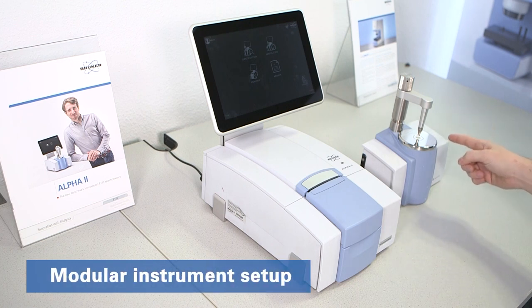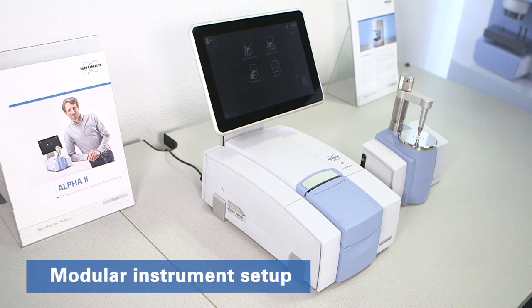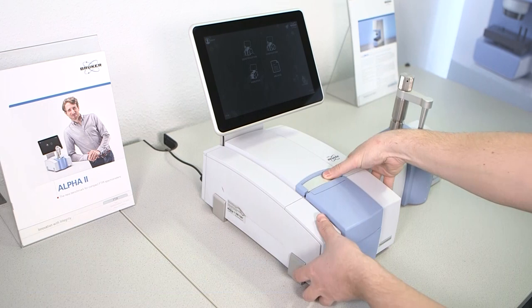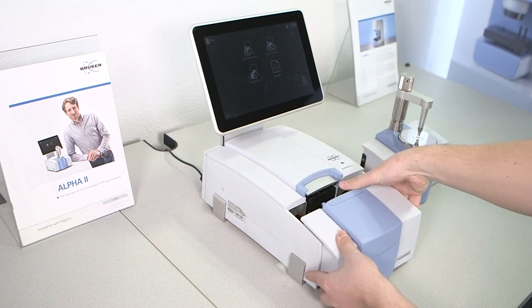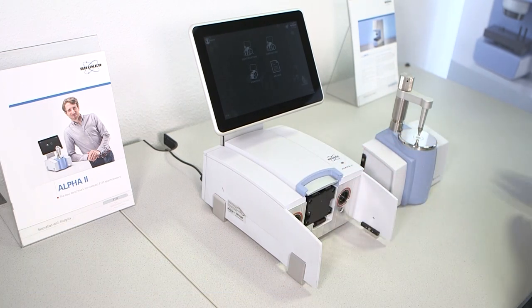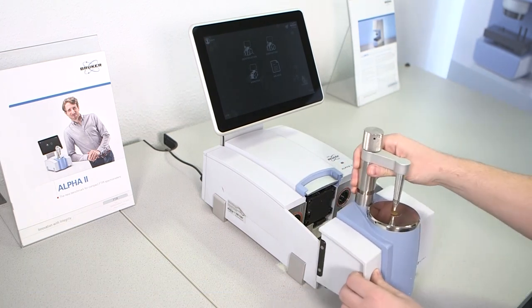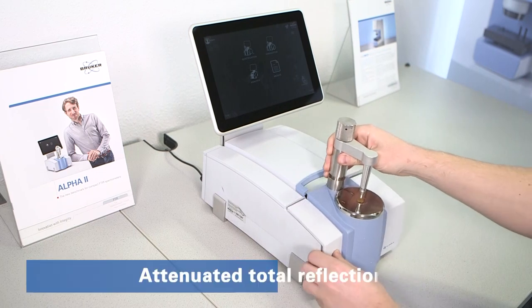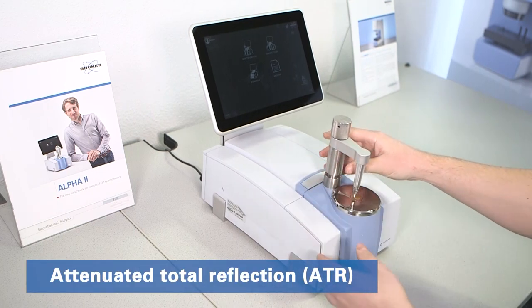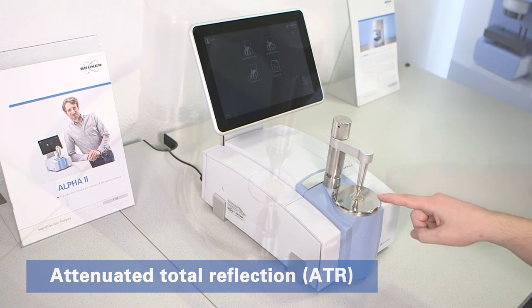Changing accessories and adapting the instrument to the sample conditions is a usual approach in FTIR spectroscopy. Right now the Alpha is equipped with a standard transmission module, but we are switching it to the most common technique used — the attenuated total reflection.